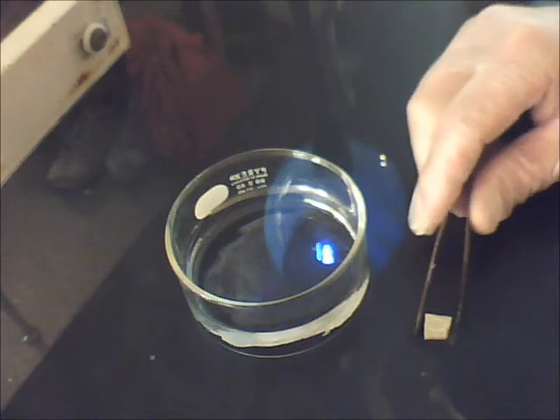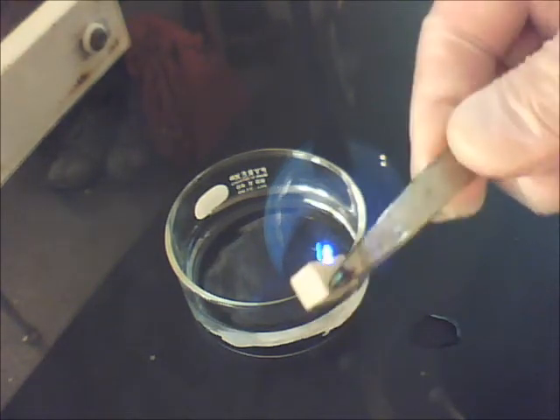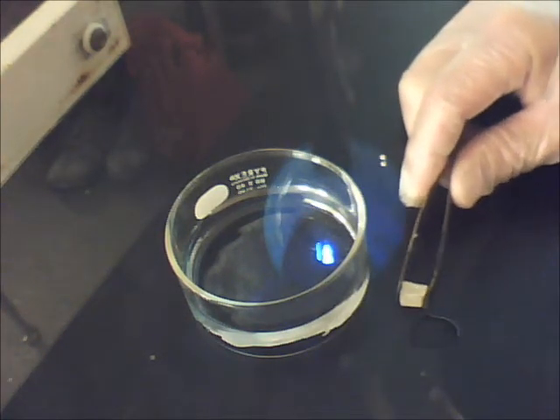So I have inside this little bottle some little chunks of sodium. Notice I'm not touching it with my hands, okay? So there's just a little chunk of sodium. Now, with the lights dim like this, what you can't see so well is that sodium has a white coating on it. All right? Okay, it's got a white coating on it. That's the oxidation from the sodium. And in order to see the shiny metal, I want to cut this little piece in two so you can see the shiny metal itself without the oxidation on it. Okay?